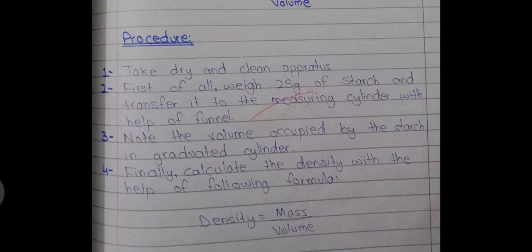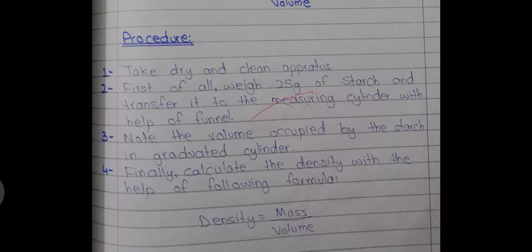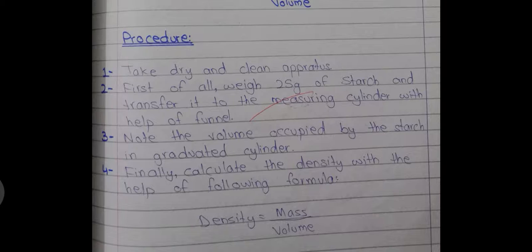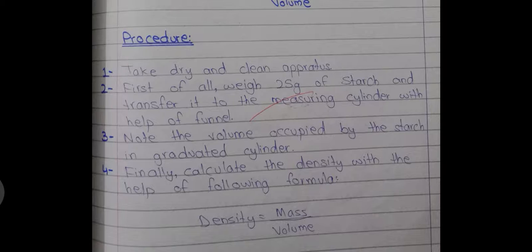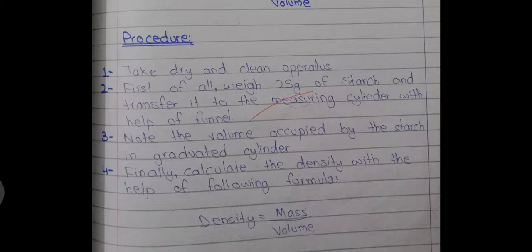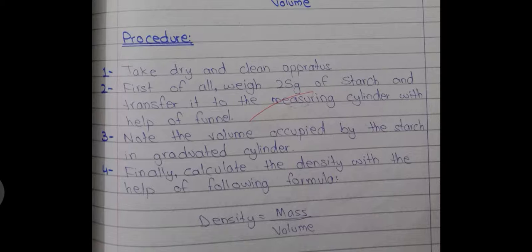The procedure is really simple. We take a dry and clean apparatus and we're going to weigh 25 grams of starch, so we already know the mass — that's one part for the density formula. We then put it into a graduated cylinder, which has markings to find the volume. We note the volume marking of how much the starch came up to for the 25 gram sample, and so we have both mass and volume.